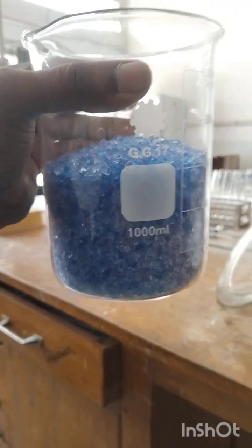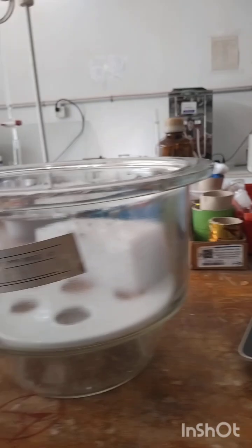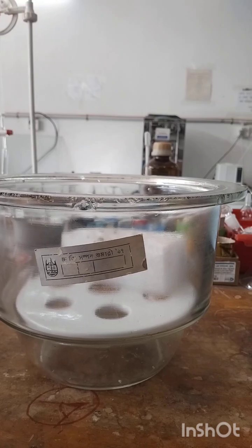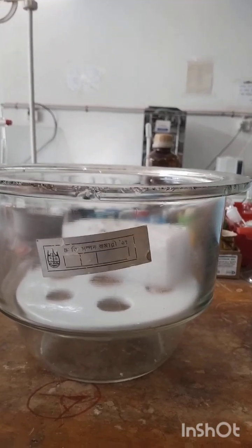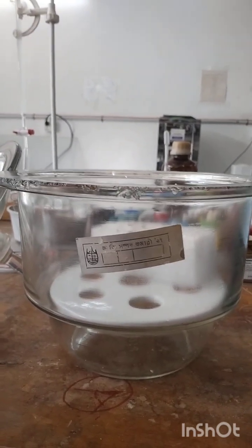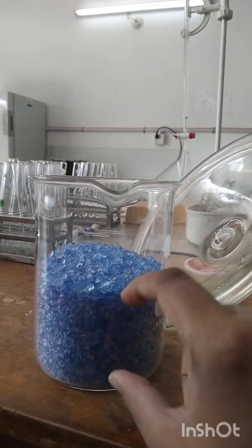This kind of desiccant you can use for keeping your sample in a moisture-free environment. And the next one, I have already mentioned some desiccant materials. So you have to keep in mind that they should be regularly checked and regenerated or replaced when you saturate them. When your desiccant is saturated, that means when a specific amount of desiccant has been hydrated, then the color of this specific desiccant will change.